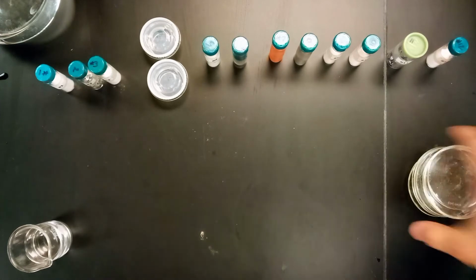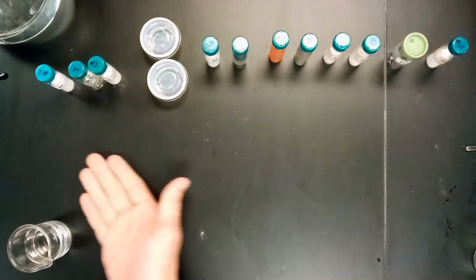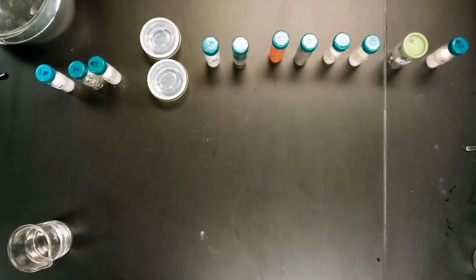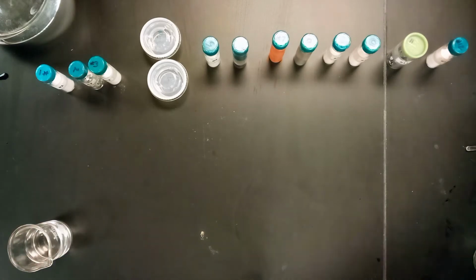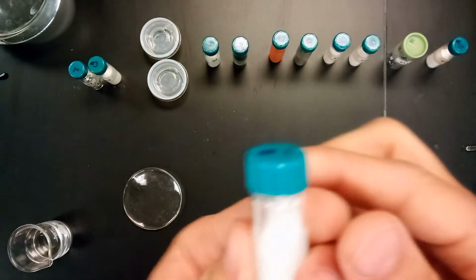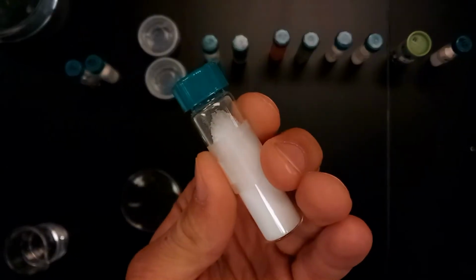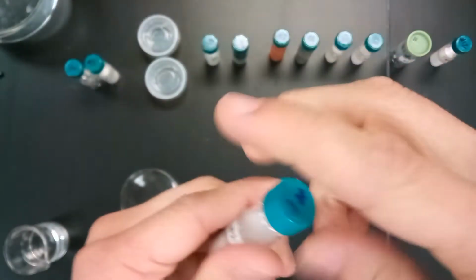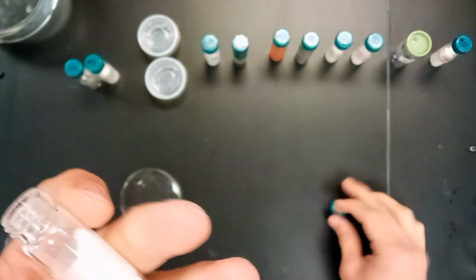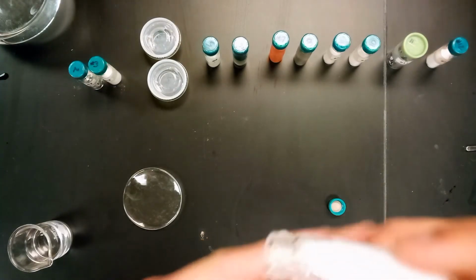So here we are, we're now going to move into the second part of this lab, trying to identify what each of these 12 items are. So I'm going to be demonstrating some things with each of them, some just procedures to try to figure out what each of them are. So we're going to start here with number 1. You can see here it's sort of a white crystal-like structure. If the camera will focus, there we go. It's some sort of maybe ionic, I don't know, it's just crystalline structure.